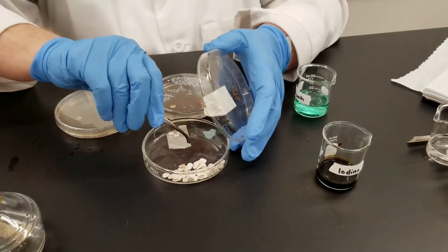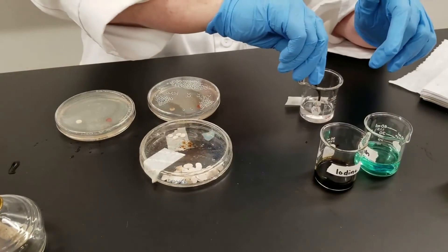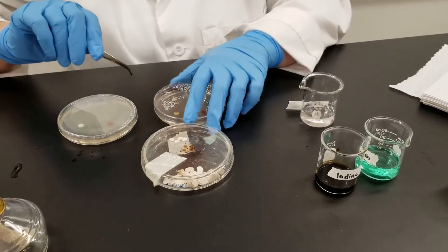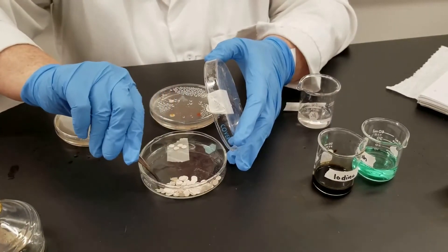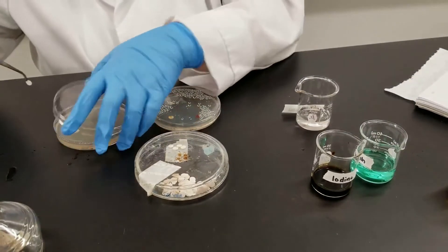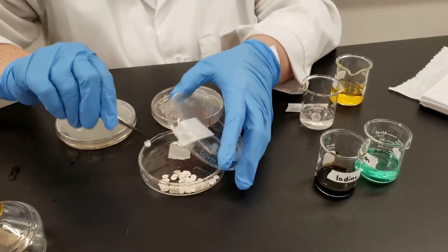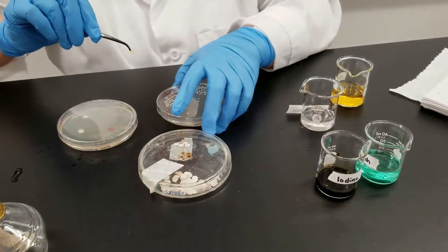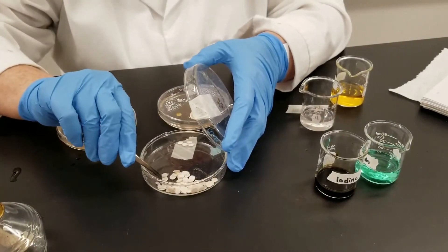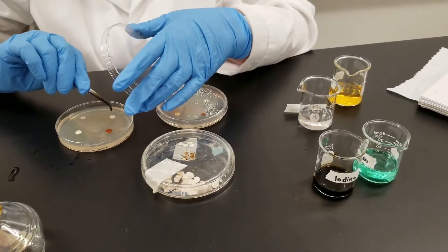Please make sure when you do this that you take careful notes of what your chemicals are and where you have placed them on the plate, so that when you come back in 24 hours you'll know which substance was which. Just lightly tap the disc so that it will stick to the agar when you go to invert the plate. You don't want to overcrowd them — that's why we are only testing four. If they are too close together, you can have interference from one chemical with the next.